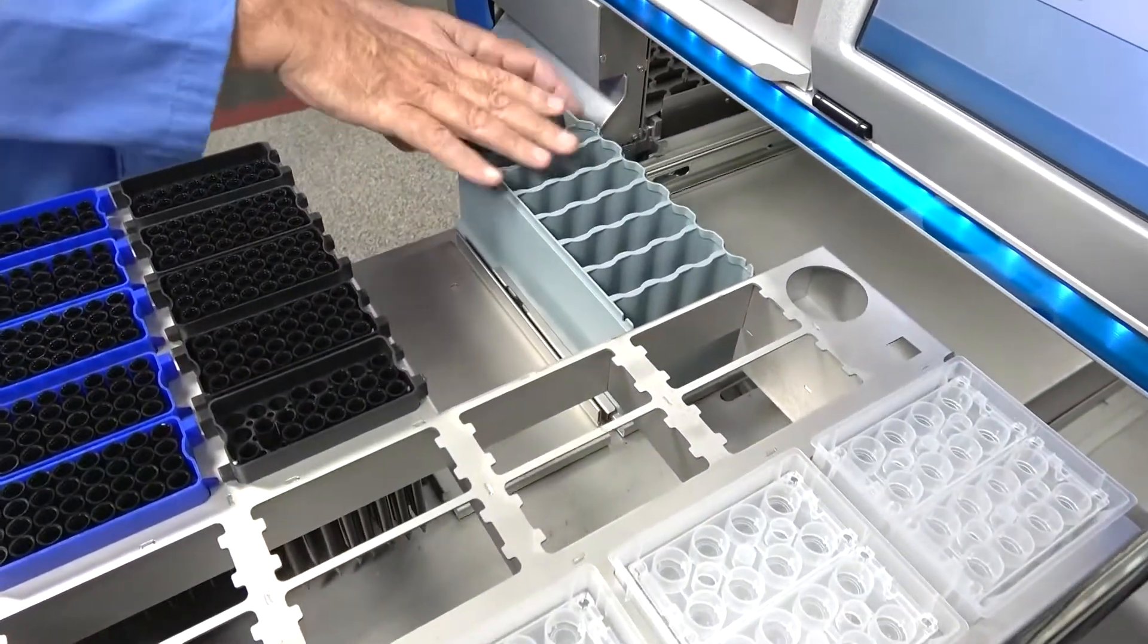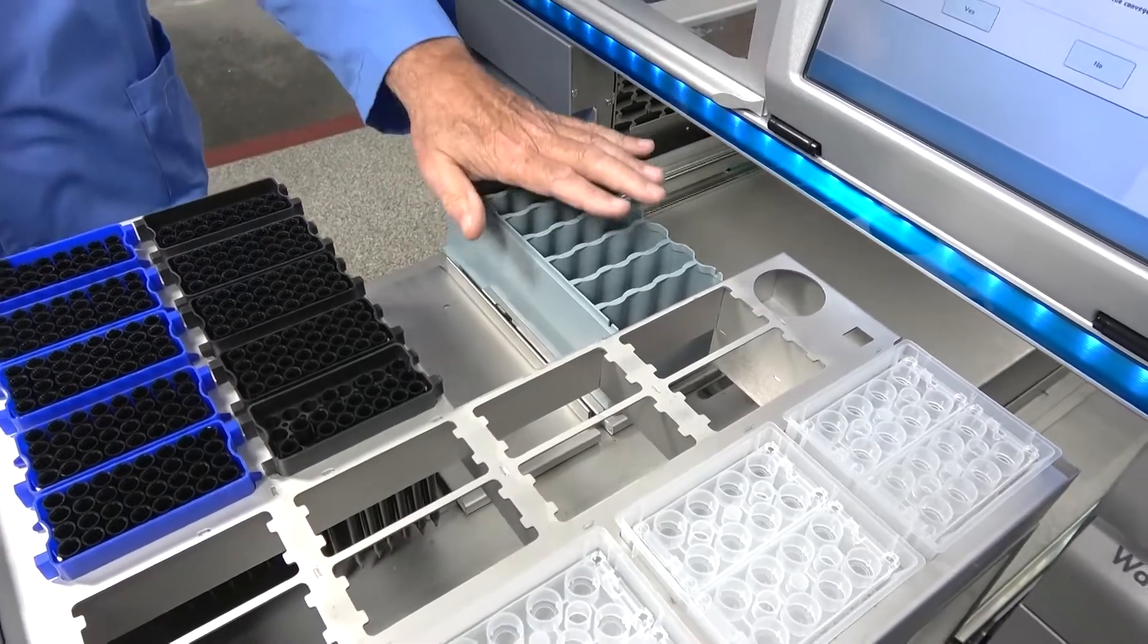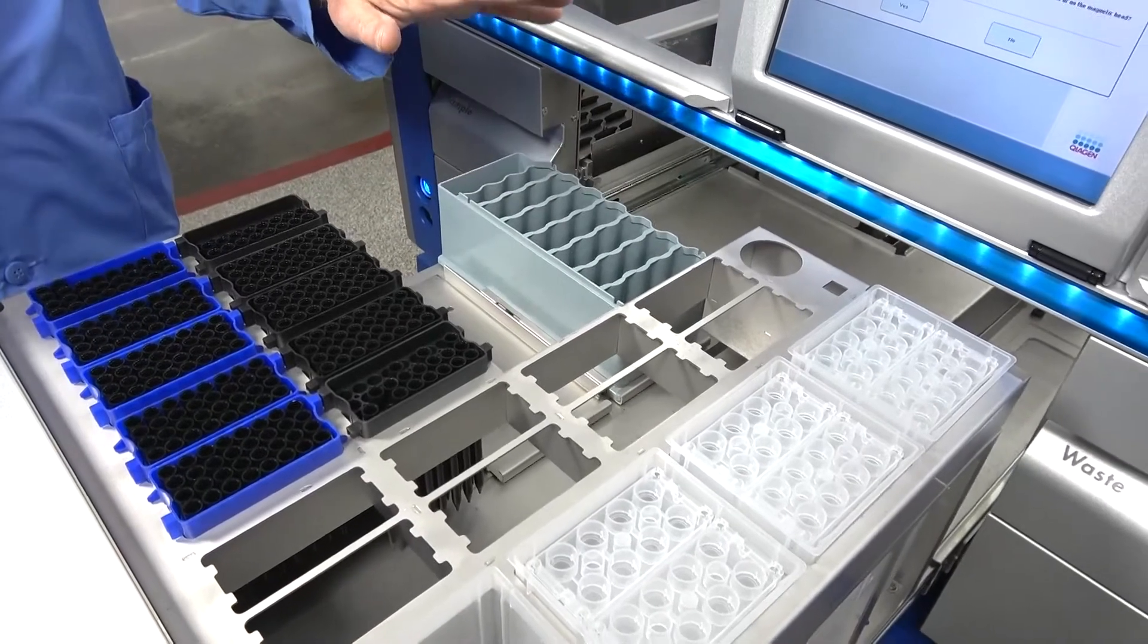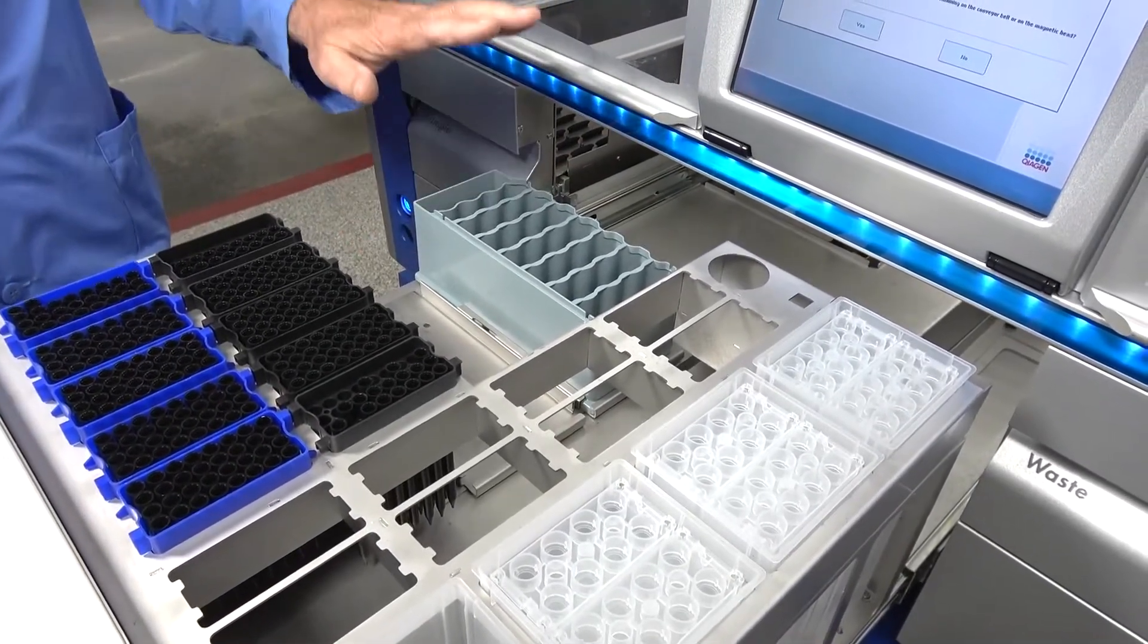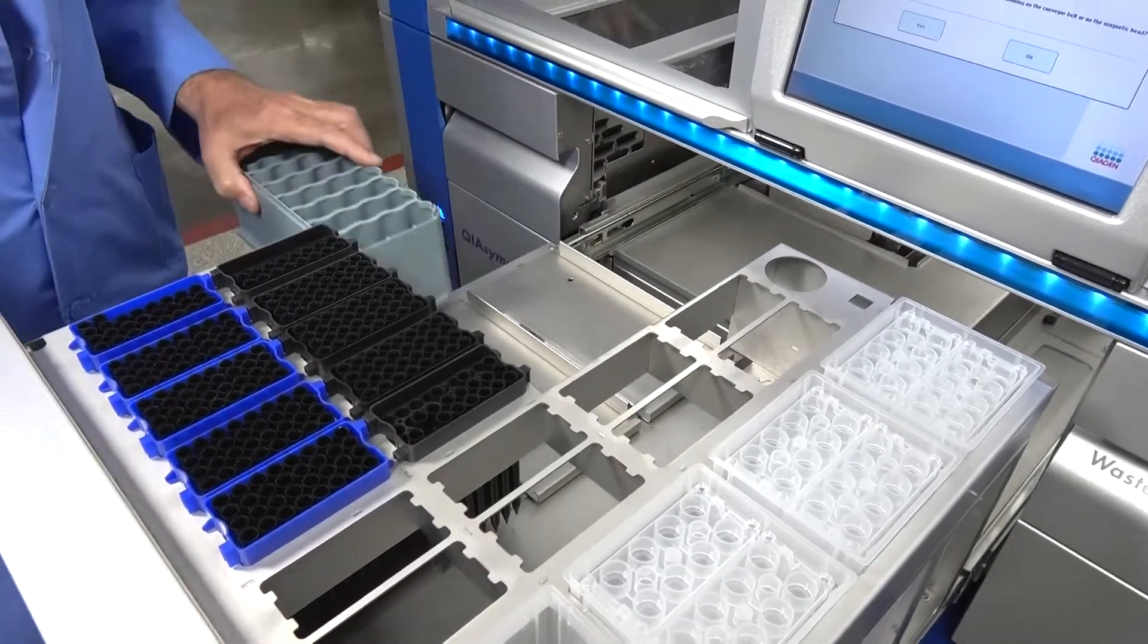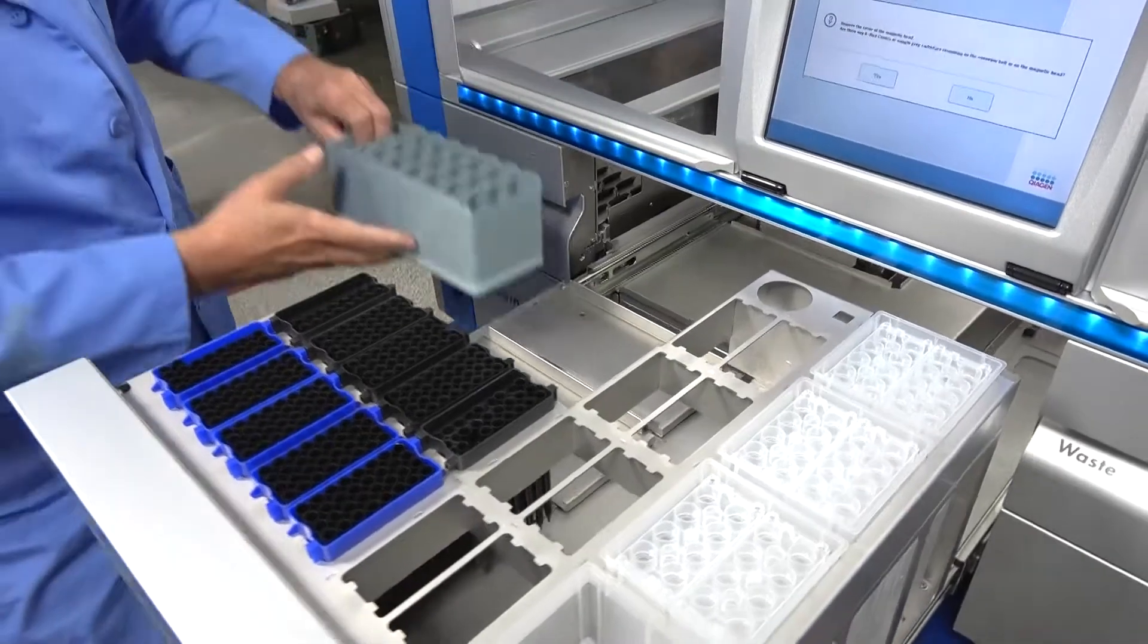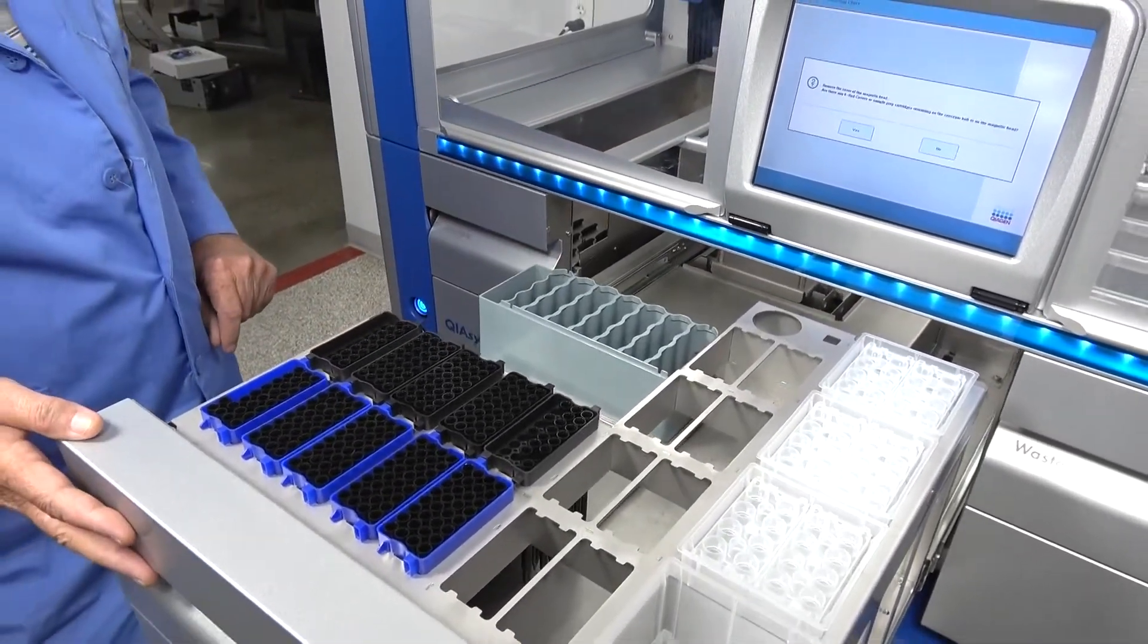It comes with one of these. If not, you're going to need to buy one of these. We always now try to make sure that we have one of these in the unit. You really can't use the unit without it. It would be nice if they all came with two, but so many of these we get don't have any. And then we have to acquire these some other way.